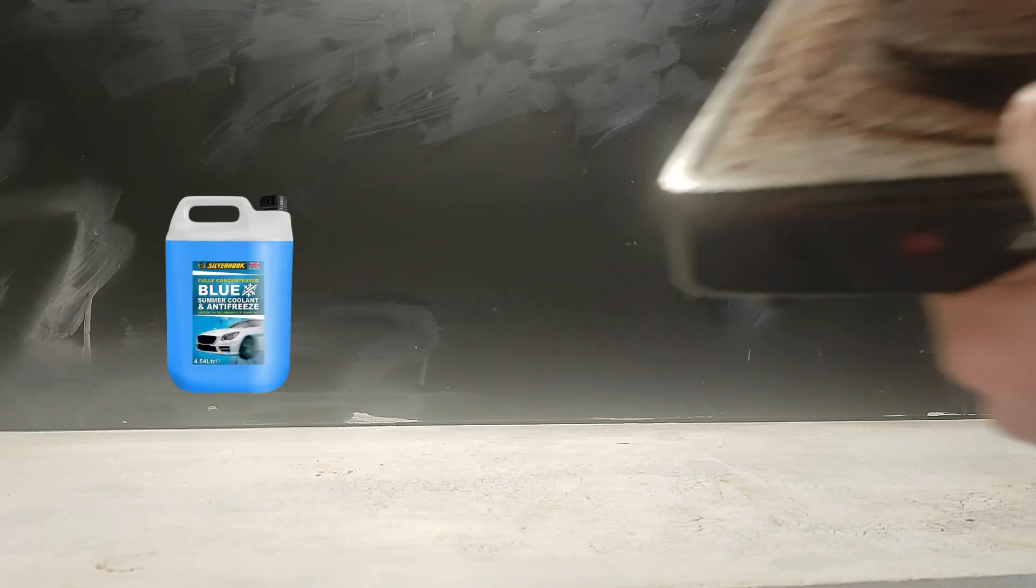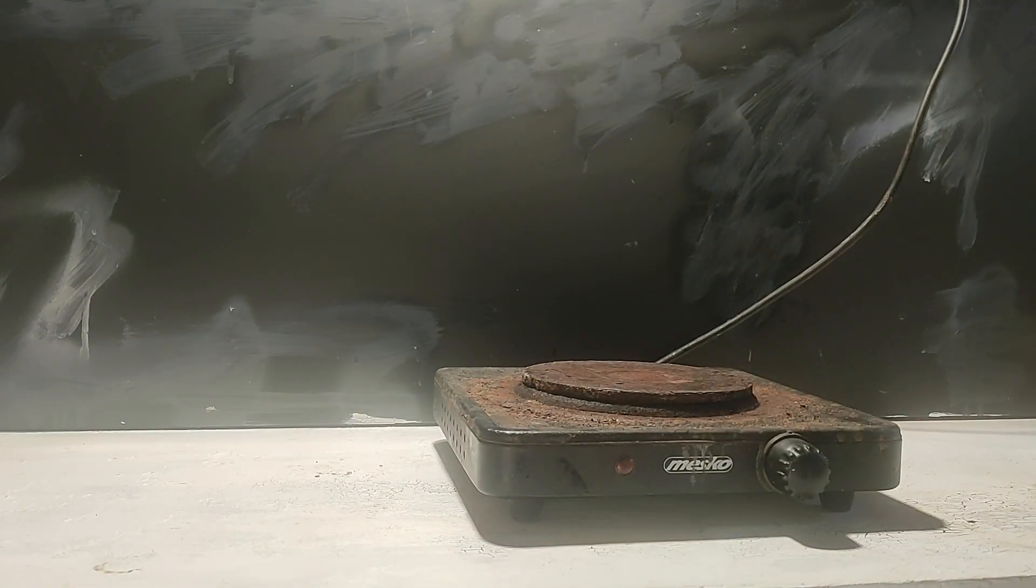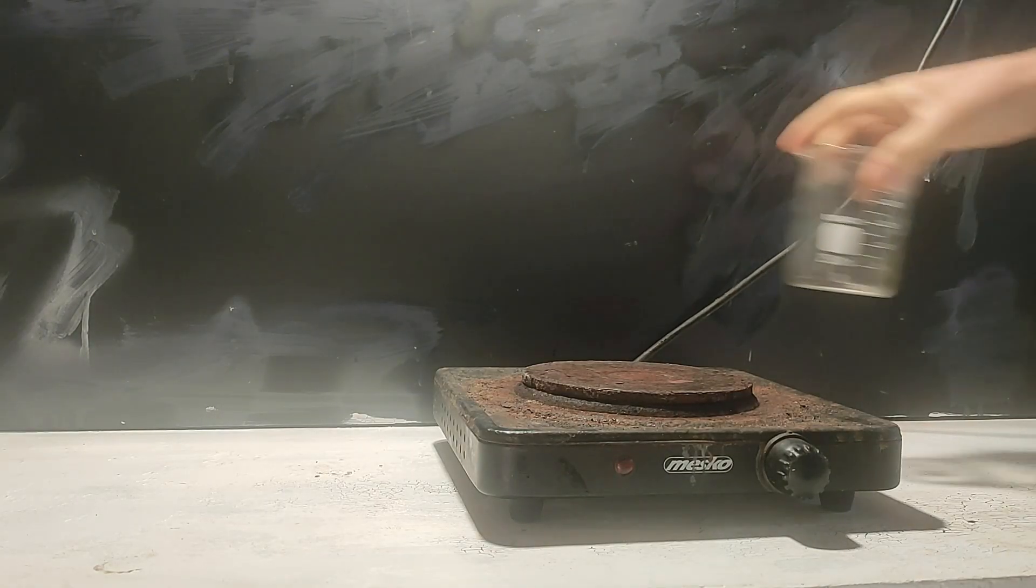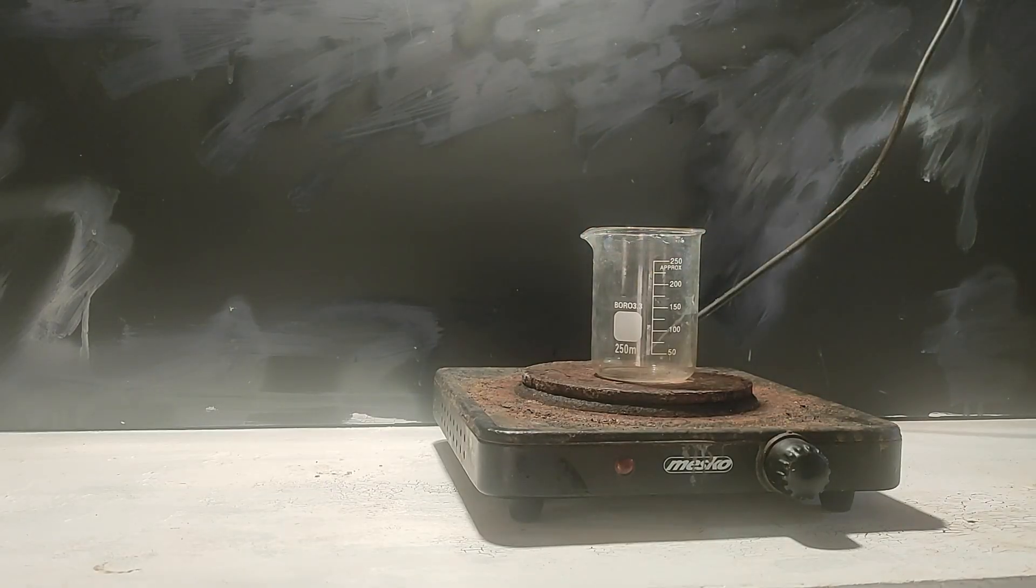Most of the time, it is sold as an anti-freeze for cars, and it's almost pure with only some blue dye. But I've only found this bottle which contains ethylene glycol, water, alcohol, and a yellow dye as well, so I had to concentrate it.